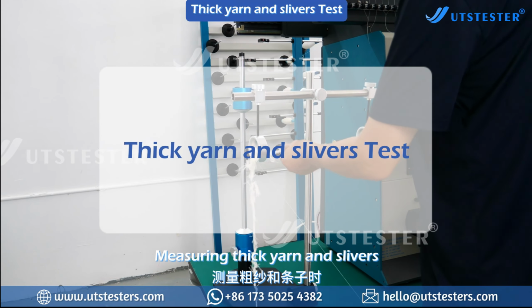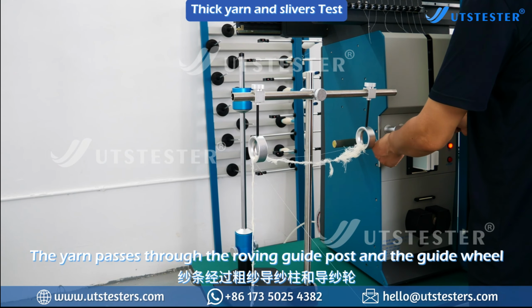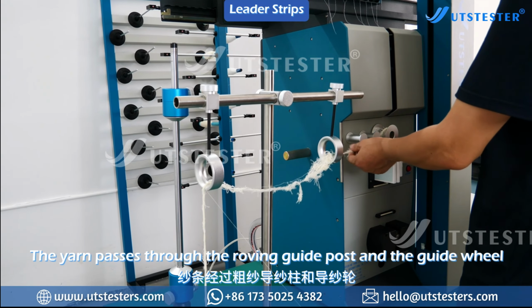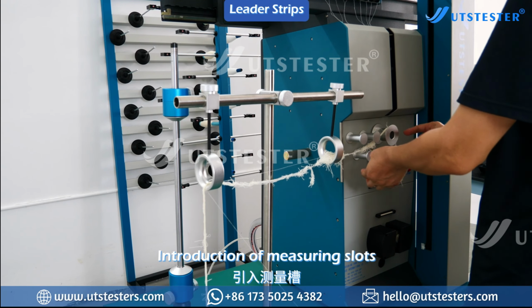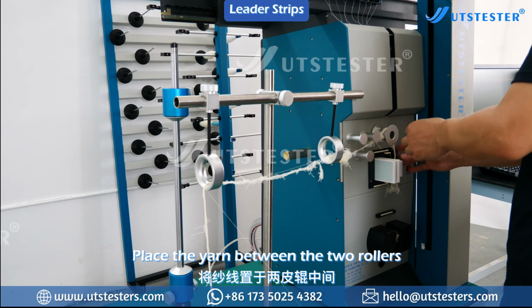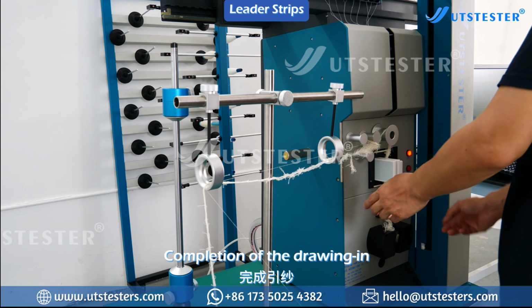Measuring thick yarns and slivers. The yarn passes through the roving guidepost and the guide wheel. Introduction of measuring slots. Place the yarn between the two rollers. Completion of the drawing in.